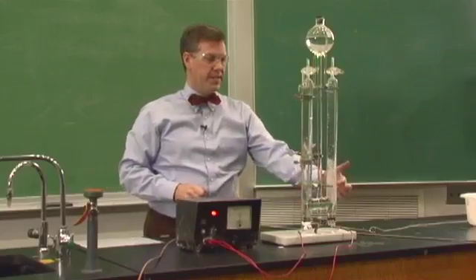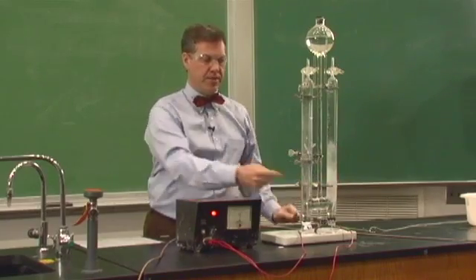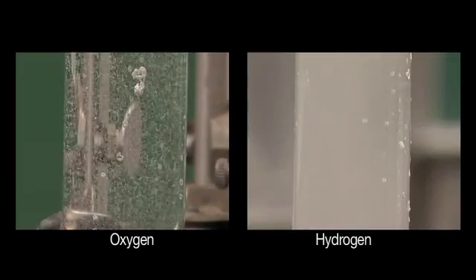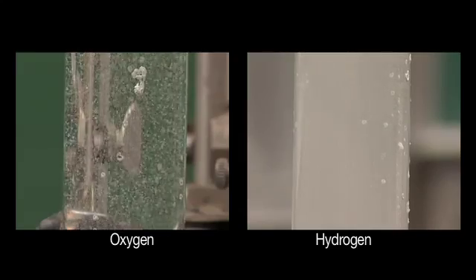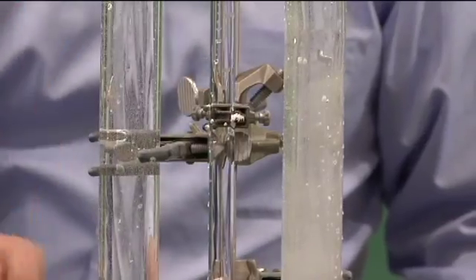If you notice, this side has significantly more bubbles than this side. That's because each molecule of water contains two atoms of hydrogen, but only one atom of oxygen. And so we're generating twice as many hydrogen bubbles as oxygen bubbles.